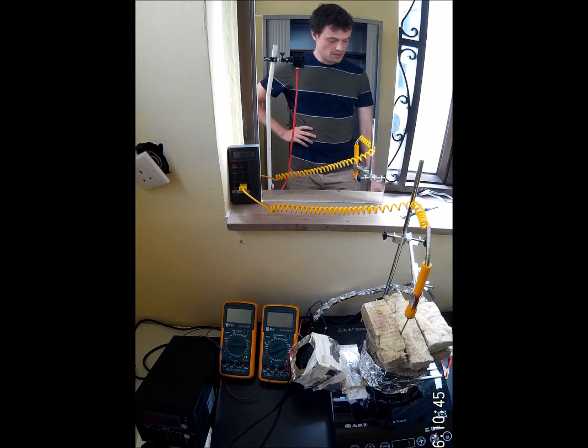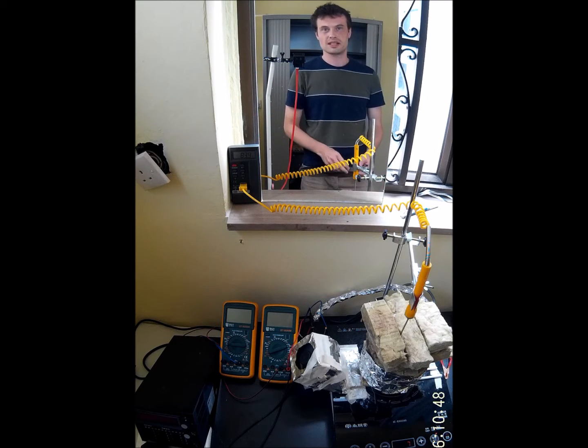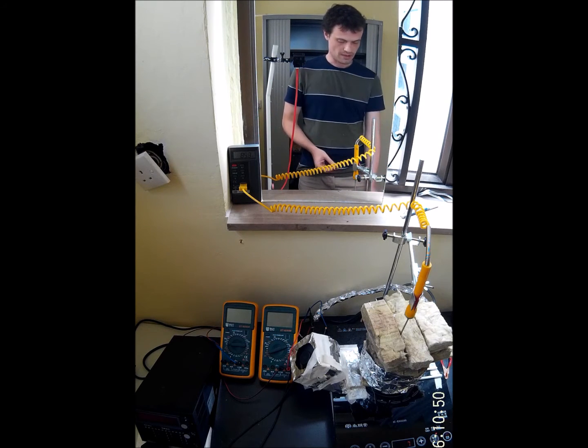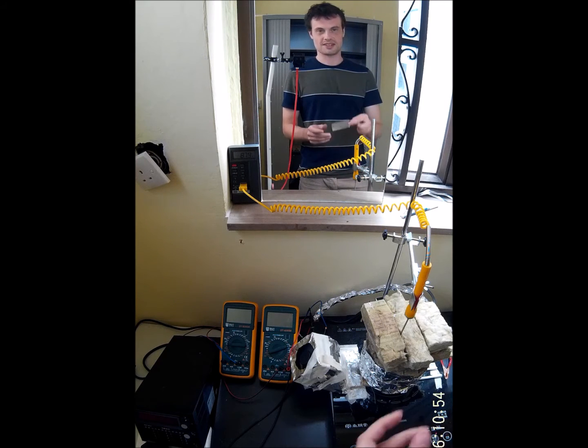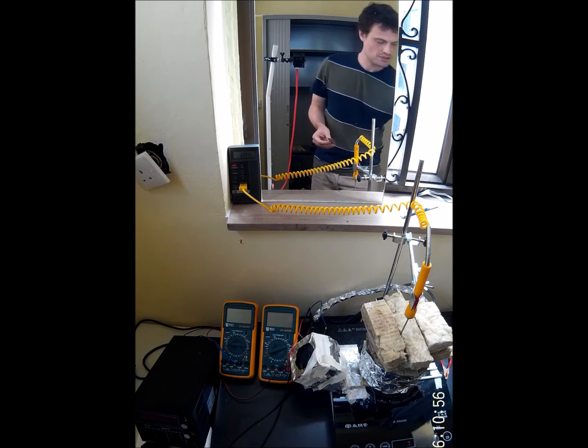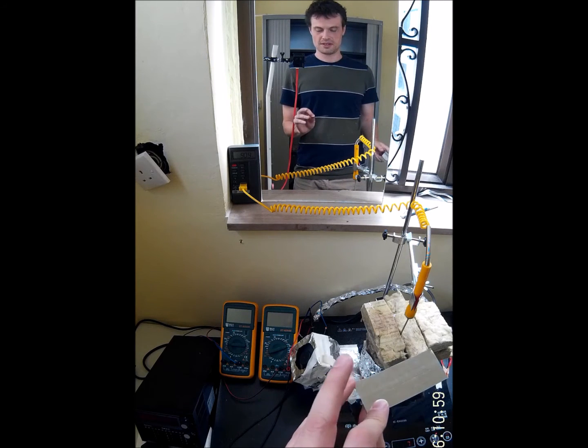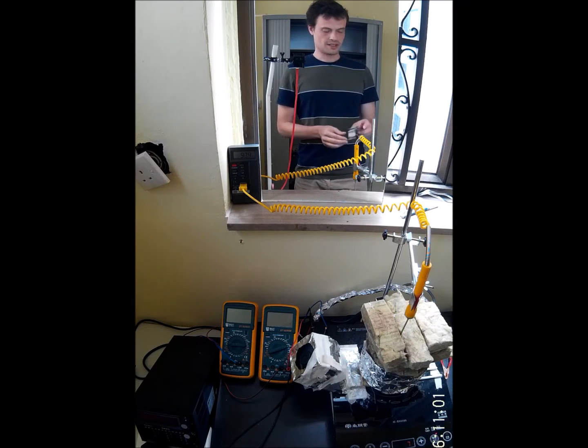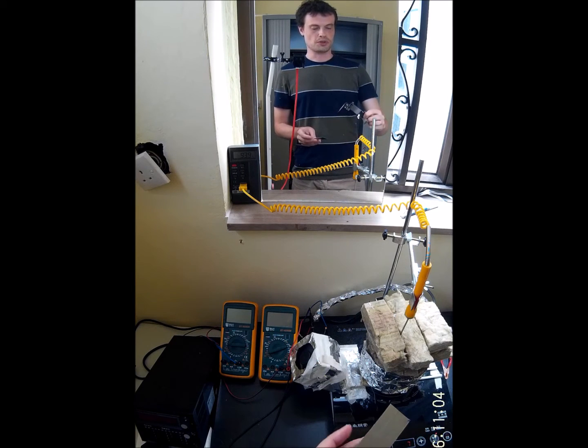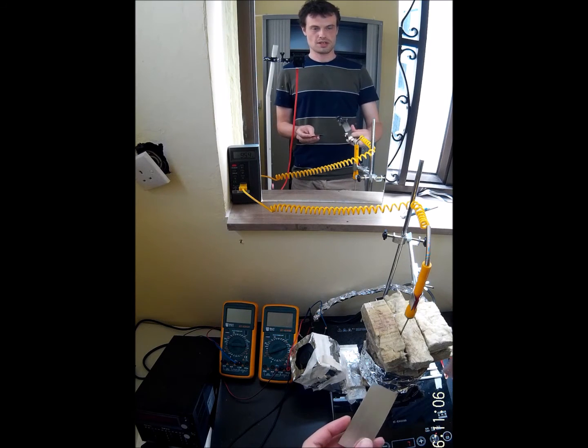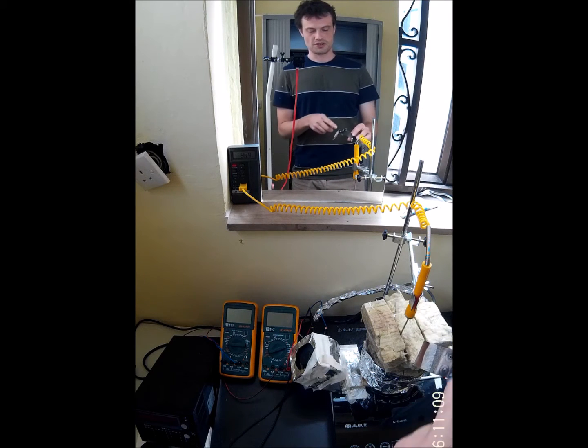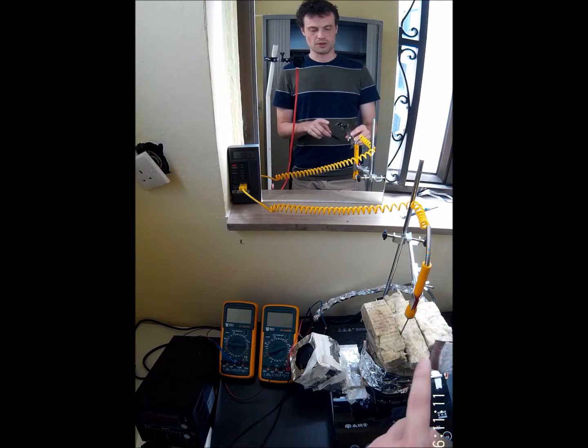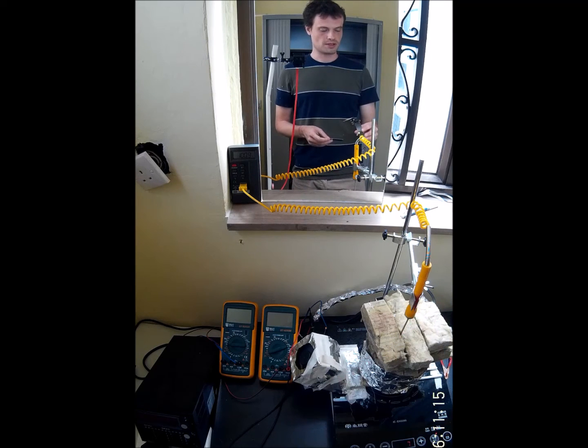Meanwhile I'll finish up the electrodes. The cathodes are still just a piece of metal here. This is the earlier support I used and I'll just unscrew the older cathode and put this new one there.